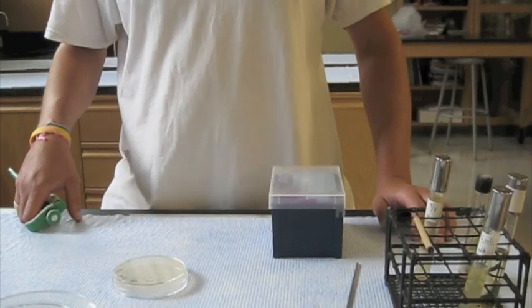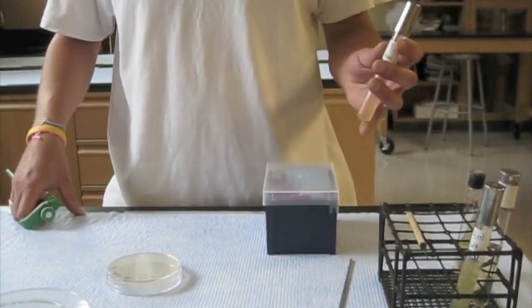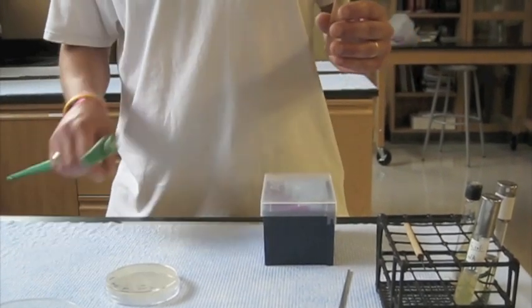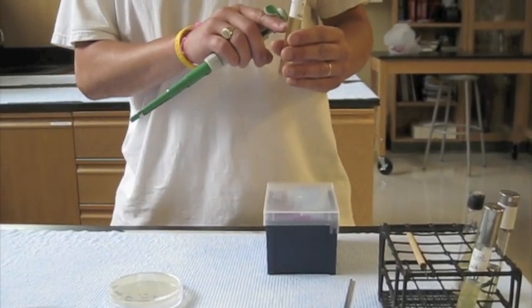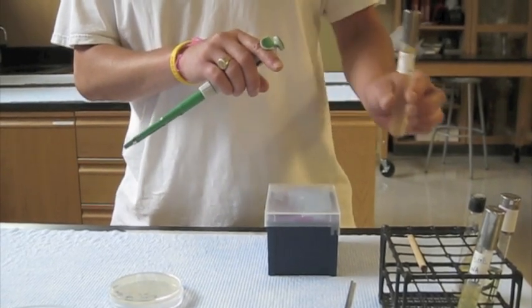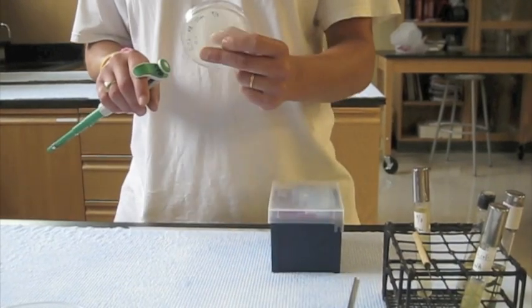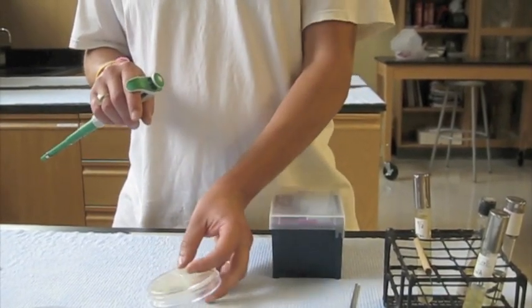In this segment of the video, we're going to show you how to take a liquid culture and do what's known as a plate of the liquid culture, where we take a measured amount of the bacteria growing in this culture tube. In this case, I'm going to take 100 microliters and spread the entire 100 microliters onto a plate, which is frequently done in plate counts, which you'll see in the lab.